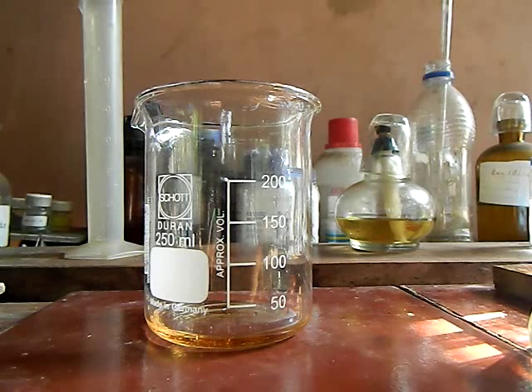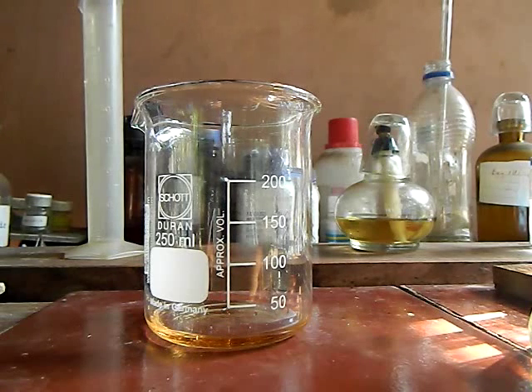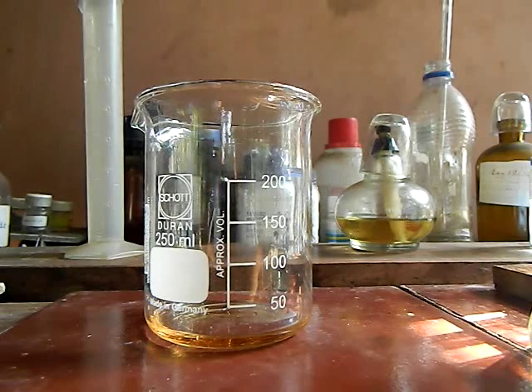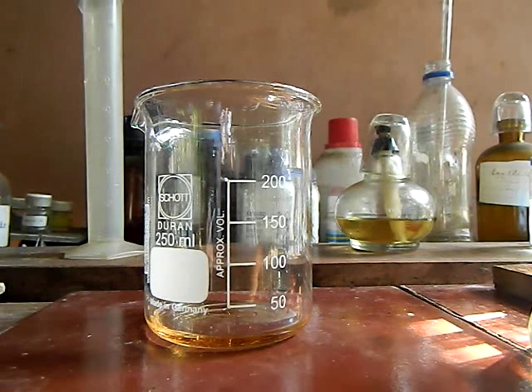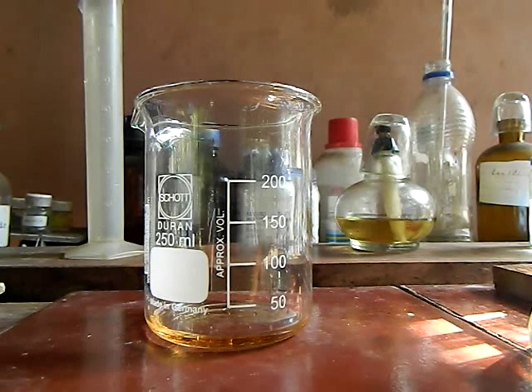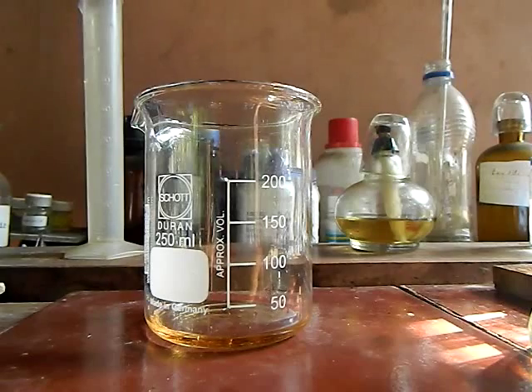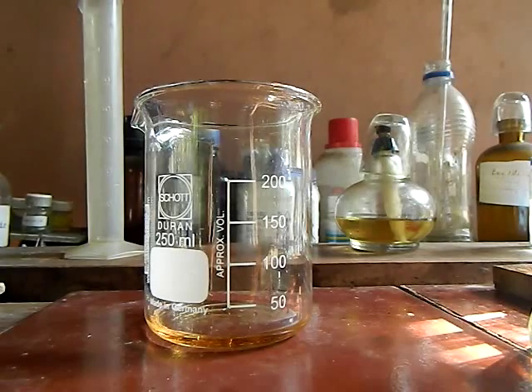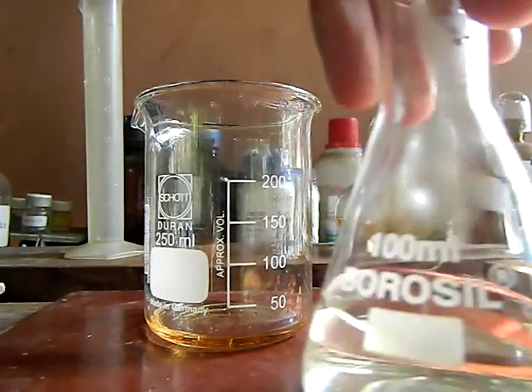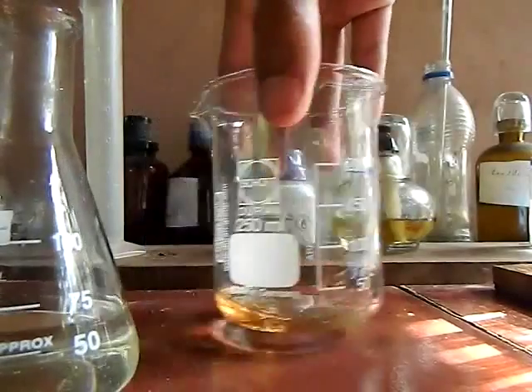In this video we will be synthesizing benzene diazonium chloride, which is a very important organic compound for the synthesis of various different kinds of organic compounds. For this experiment we need 65 ml of concentrated hydrochloric acid and 10 ml of aniline.